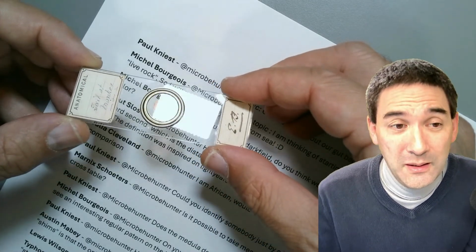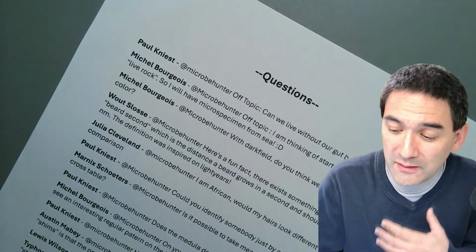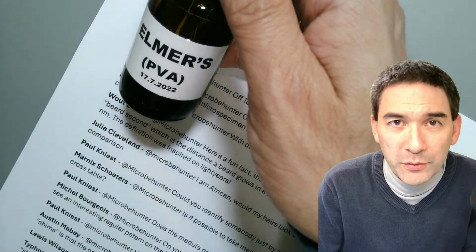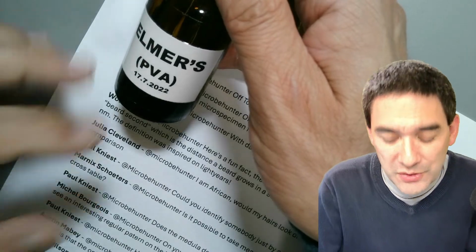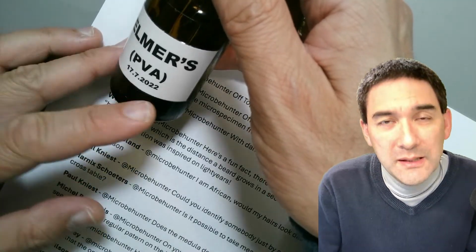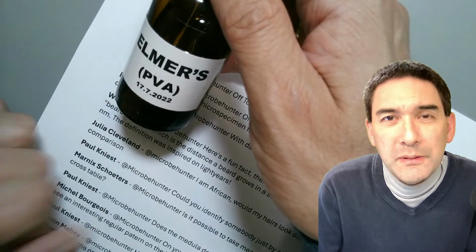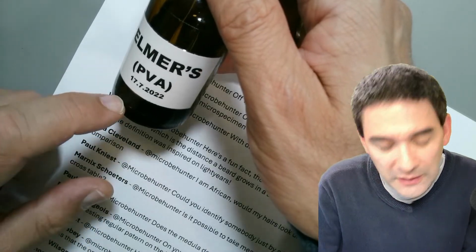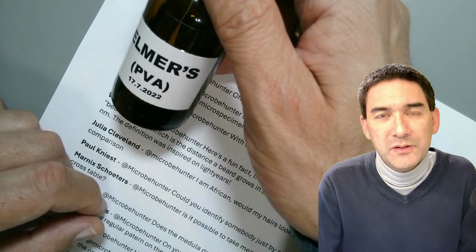Yeah, I would probably say that this is not homemade, I mean, this is just regular PVA glue which I bought from Amazon. It's not official mounting medium, so to say. If you really want to make slides that last a very long time, you should probably use laboratory grade PVA mounting medium or any laboratory grade mounting medium, because I don't really know if they've added additives or not.